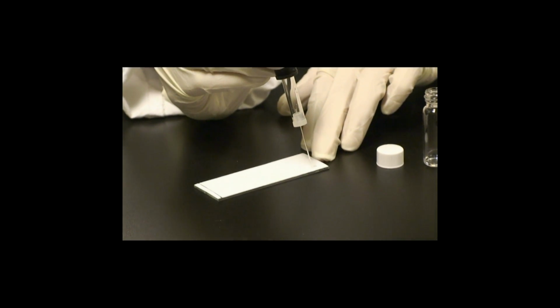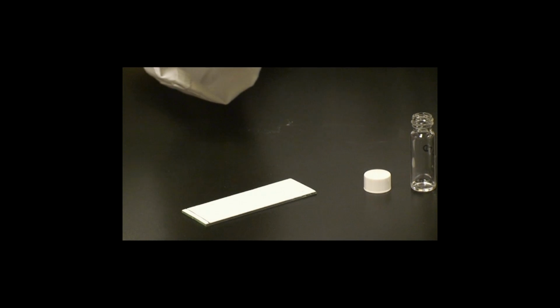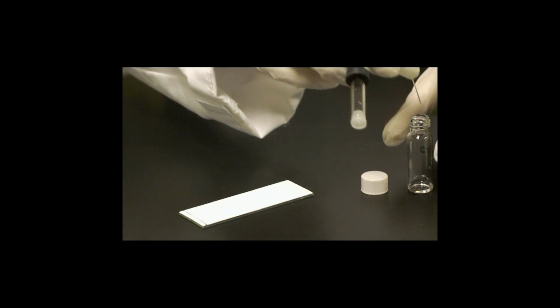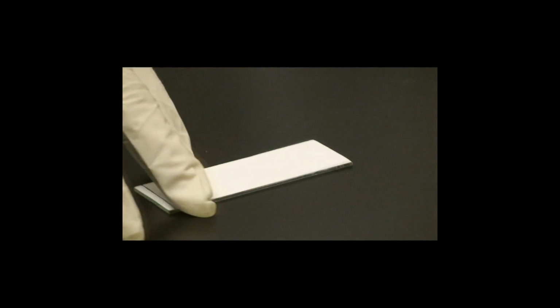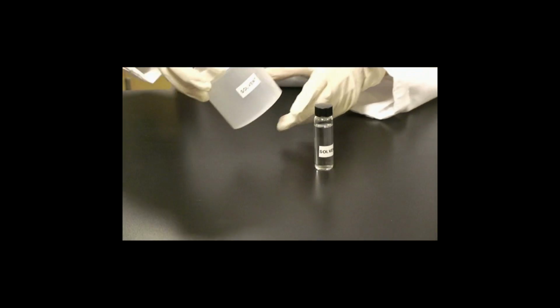Hold the plate steady and place a sample about 1 centimeter from the bottom of the plate. Touch the end of the pipette to the TLC plate. Place a finger over the hole at the top of the bulb and gently squeeze. The sample will be dispensed onto the TLC plate. Using a new microliter pipette in the suction bulb, repeat this step for each of the other samples to be plated. Place the samples about 1 centimeter apart horizontally. The plate will hold a maximum of 4 samples. After loading all samples, including the 5% triglyceride sample, let the TLC plate dry for about a minute.